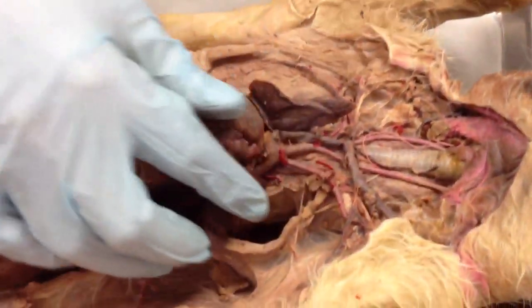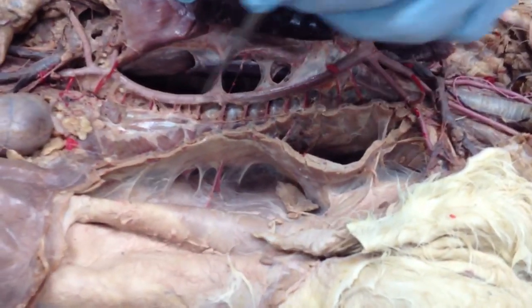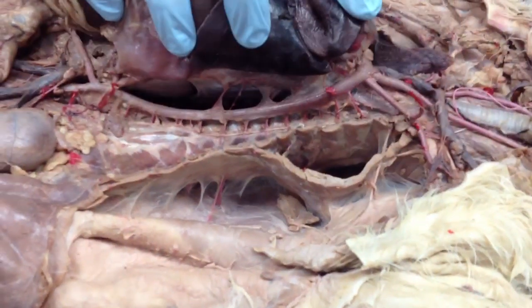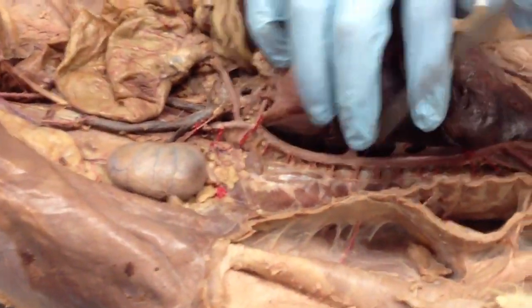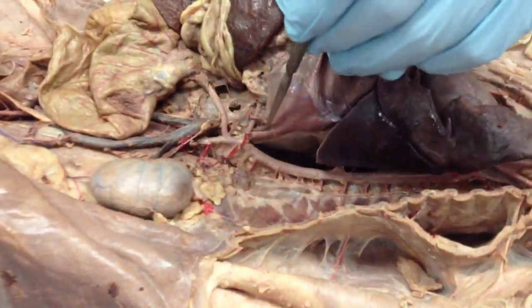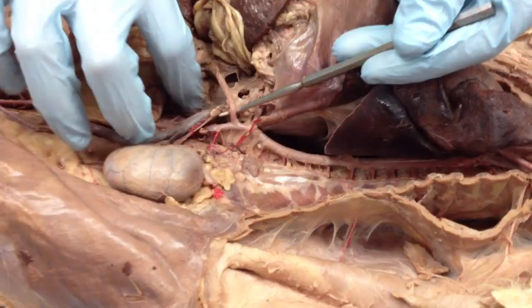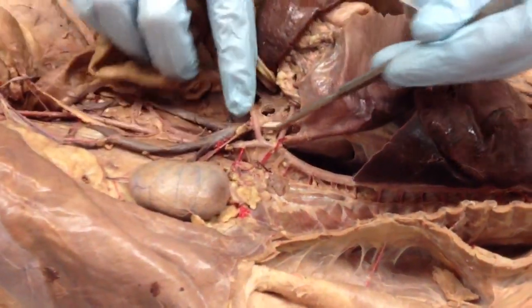Alright, so back to the aorta, remember the aortic arch. That continues on down right there. So this is the thoracic cavity, that's your thoracic aorta. These little guys coming off of it are your intercostal arteries. And if you follow that aorta, they divide it up into thoracic and abdominal aorta. If you keep following it, you'll see your celiac artery here branching off of it. And just below that is your superior mesenteric artery. So that goes to your mesentery, your small intestines, all this stuff.